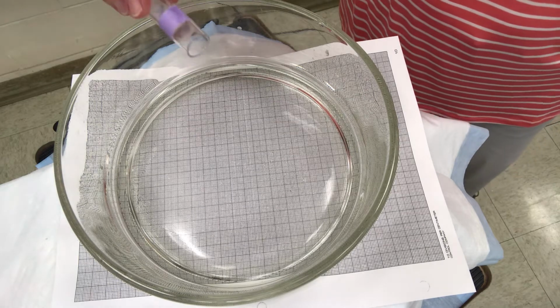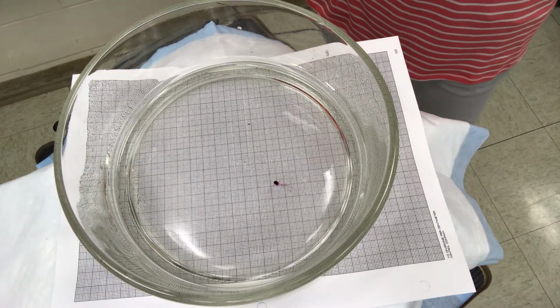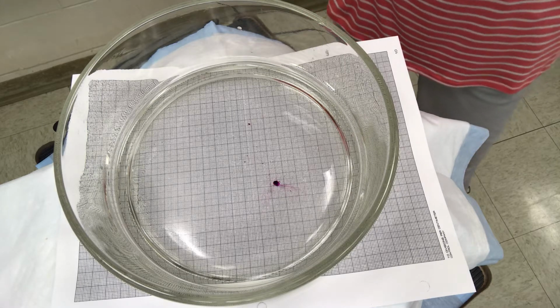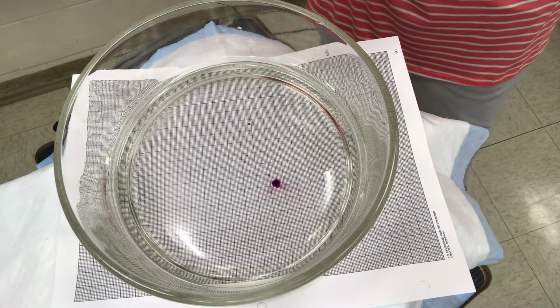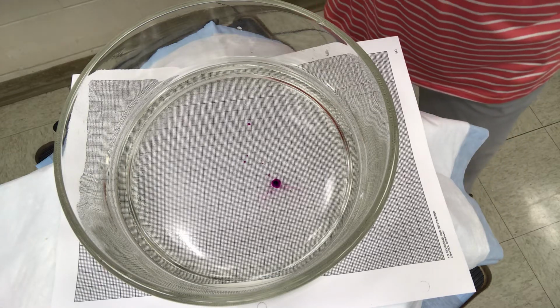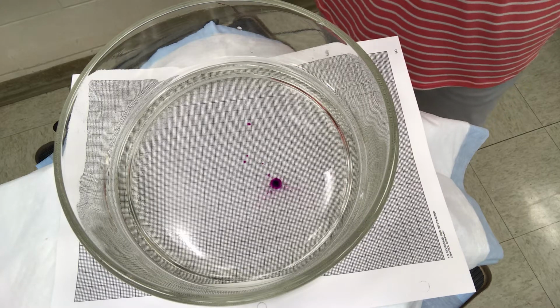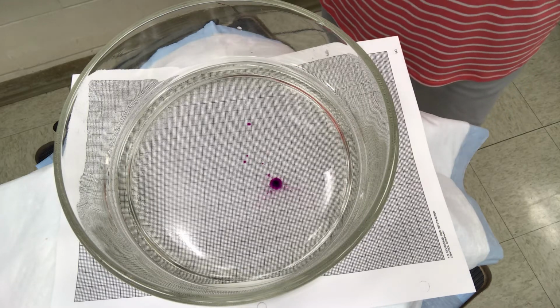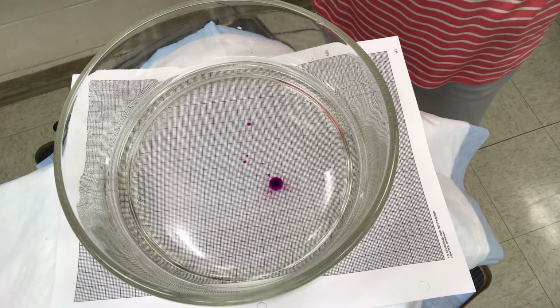So with this, we're dumping in a potassium permanganate crystal, and we're going to start. It's very dark purple in the center, and you can already see that the water is starting to diffuse and change color. The dye is moving outward, and there is movement from high to low, and given enough time, the whole water will turn the lighter purple color, because it will diffuse equally throughout it.